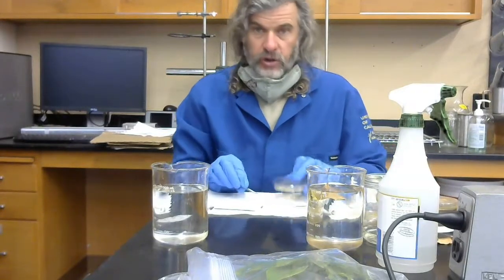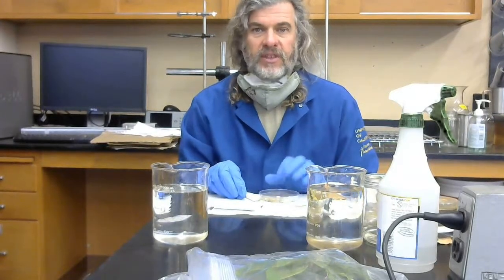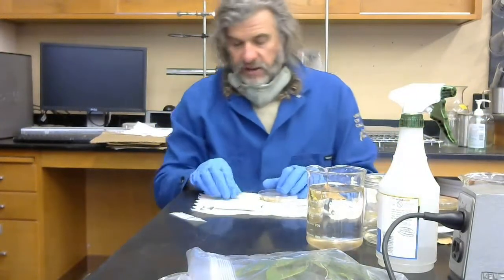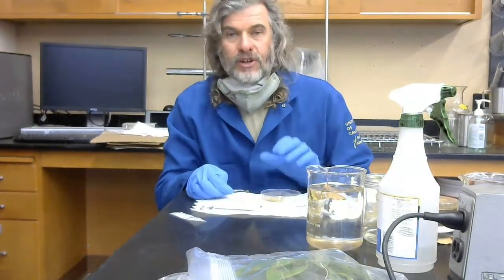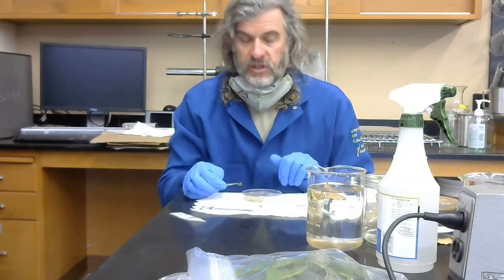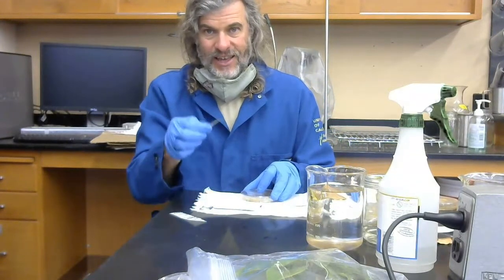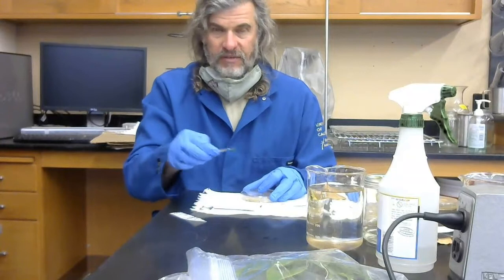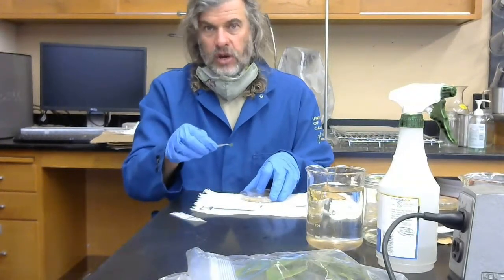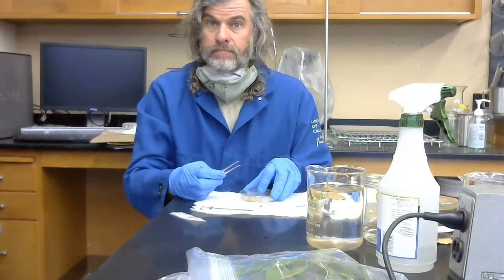Now, here is good technique. I've got my plate like this, and I've got my left hand sitting on top of the plate like so. The reason for that is I'm going to try to open this plate for the shortest period of time possible. I am going to only open it long enough to get this little leaf bit in here. I'm going to take this leaf and kind of saw down into the media so that it's standing straight up or it's in at an angle. So do that, and that's it.